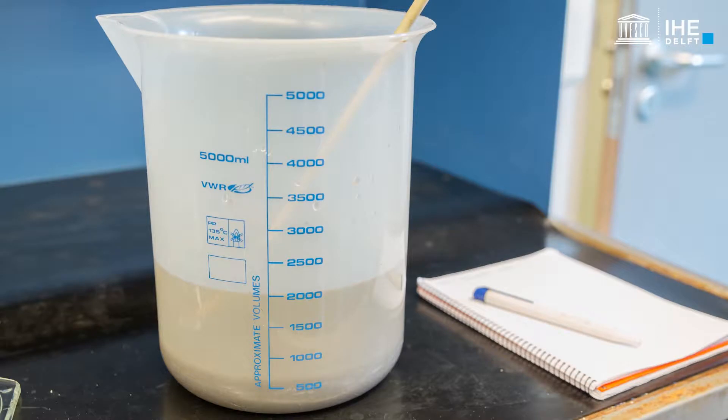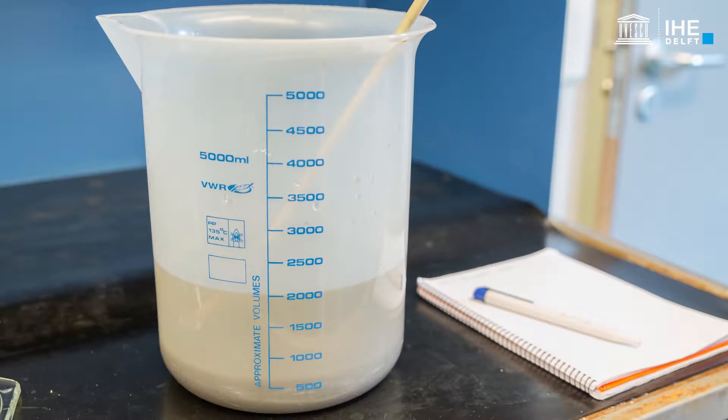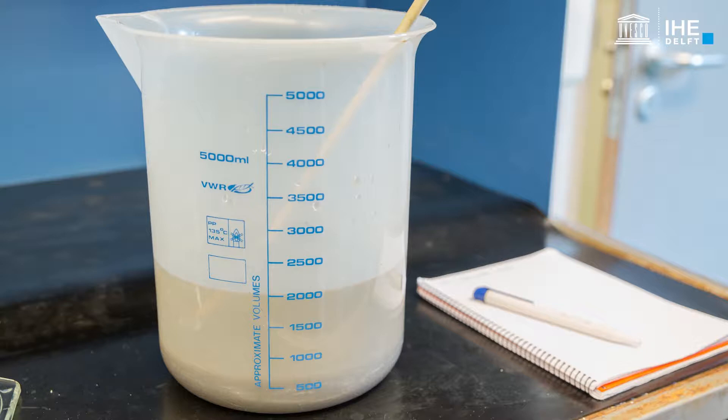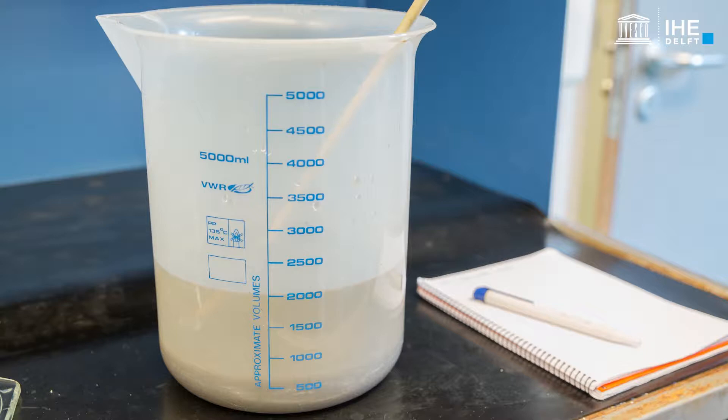An SVI settling test is performed by determining the volume of 1 litre of activated sludge sample after 30 minutes of settling.